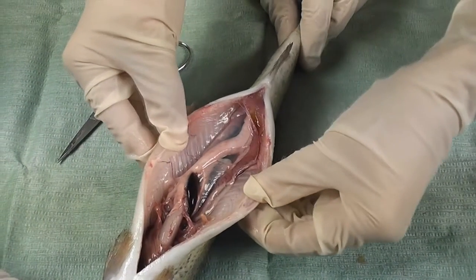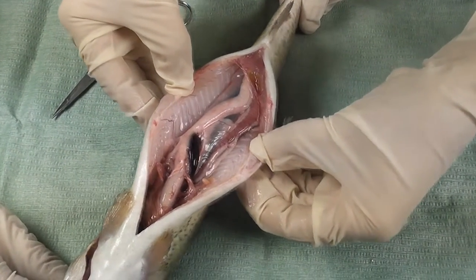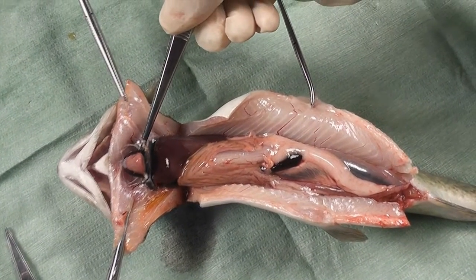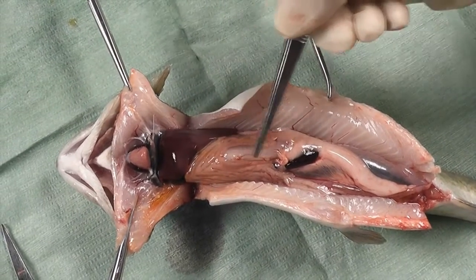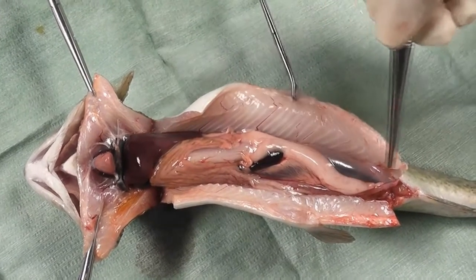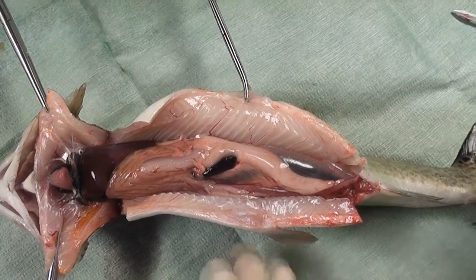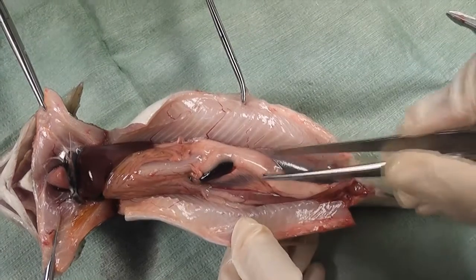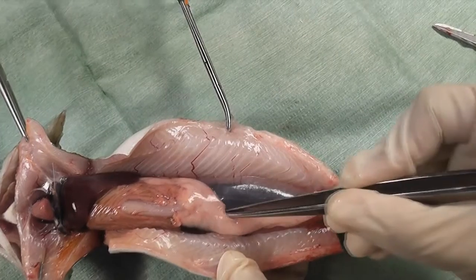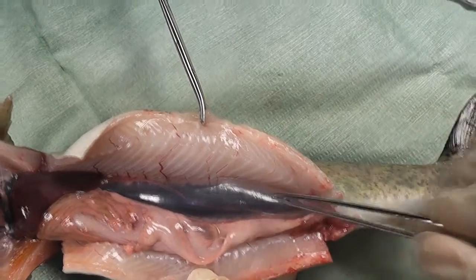We proceed with the dissection. After the dissection, we can describe the heart, which is very close to the gills, the presence of the intestines, and we want to observe also the presence of the swim bladder or air bladder.